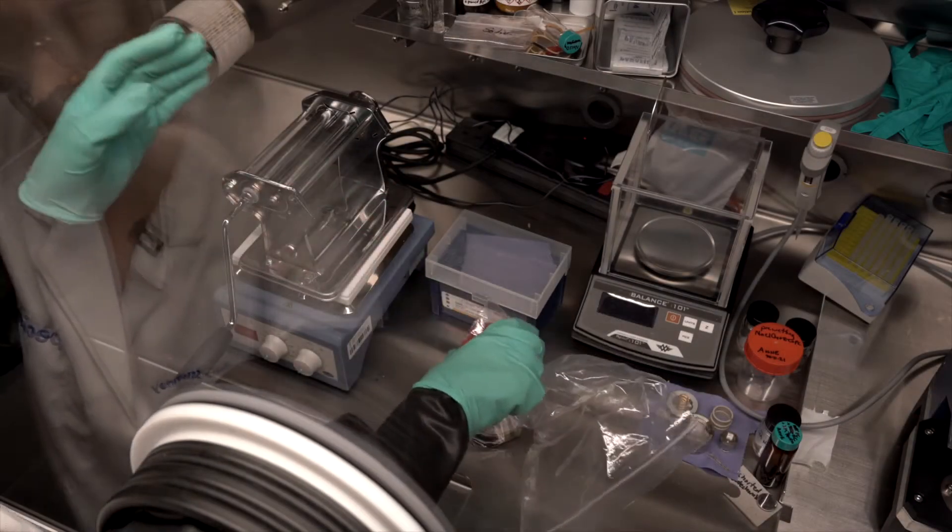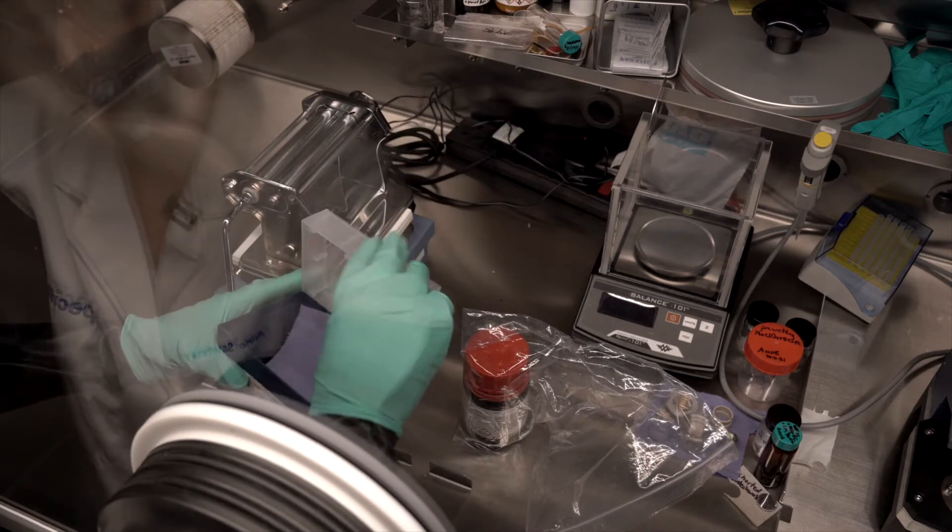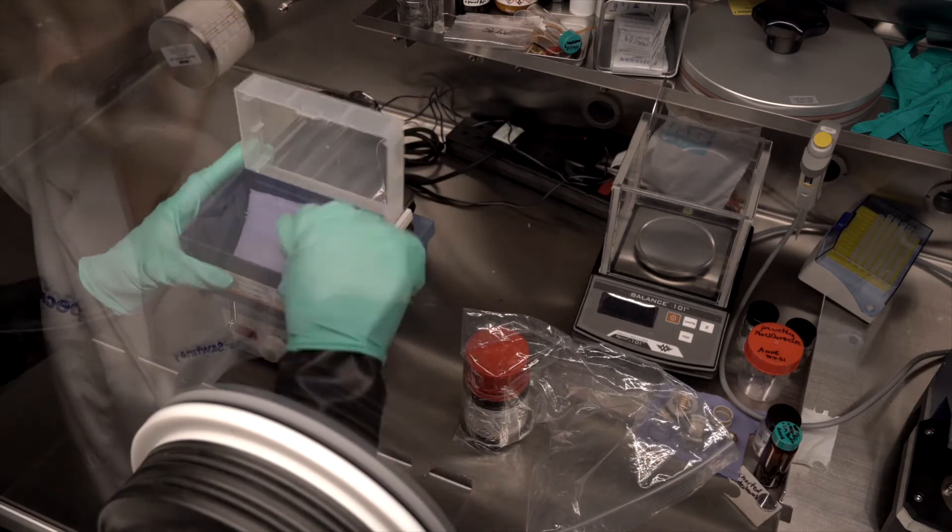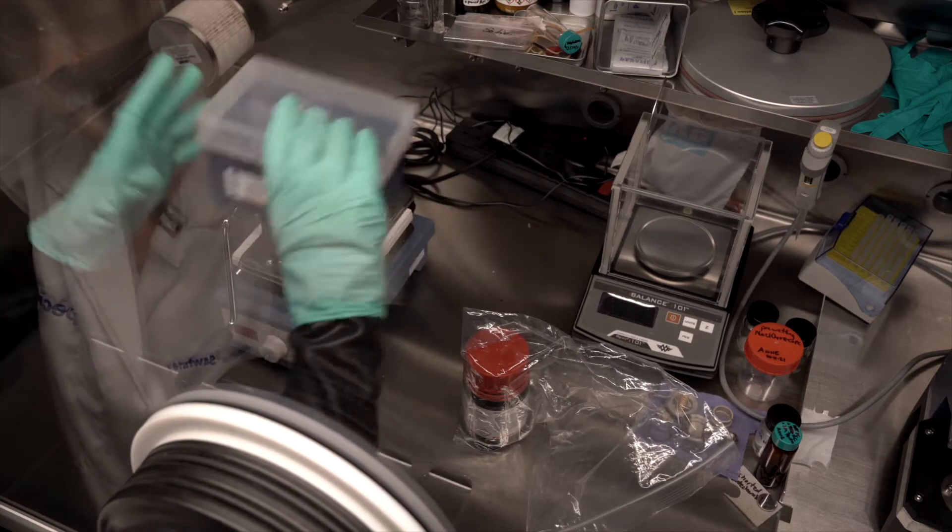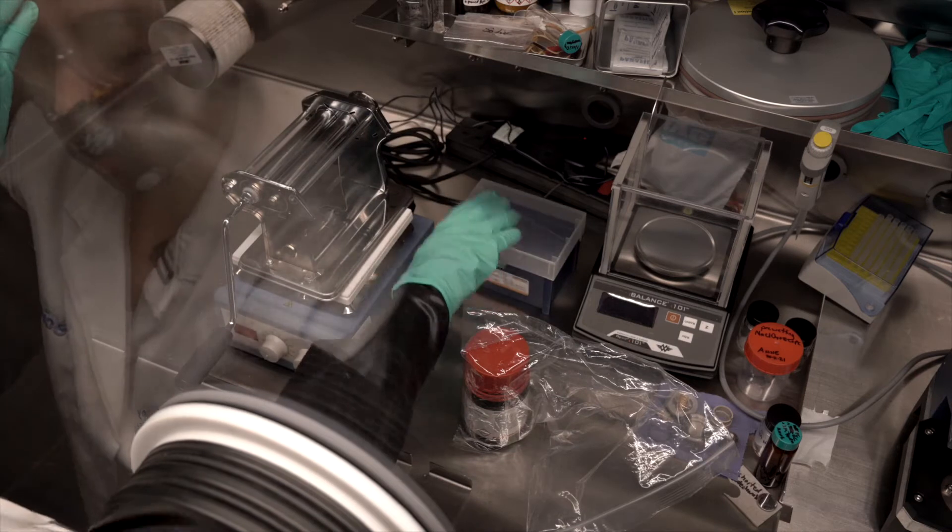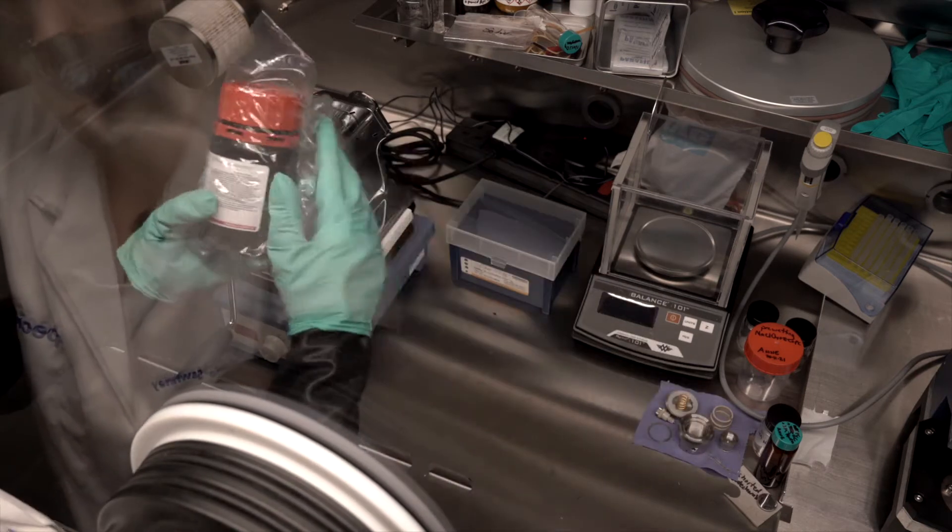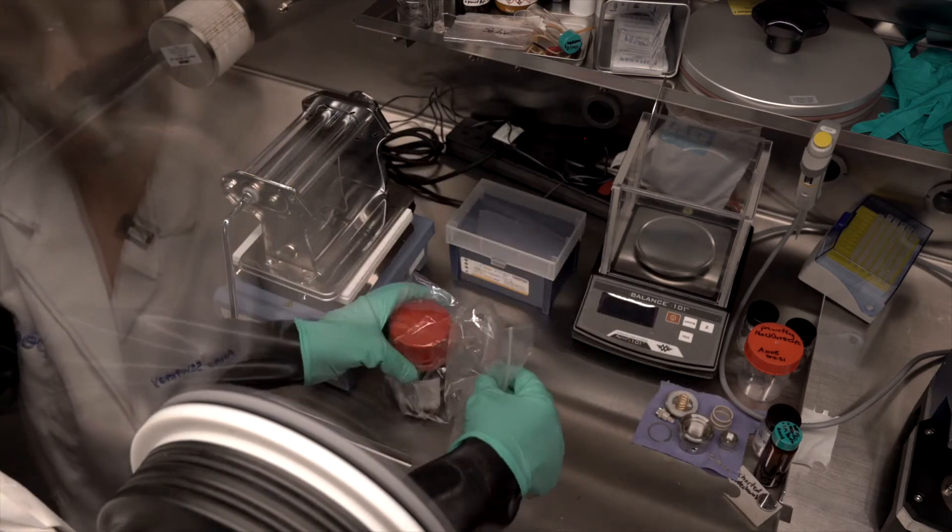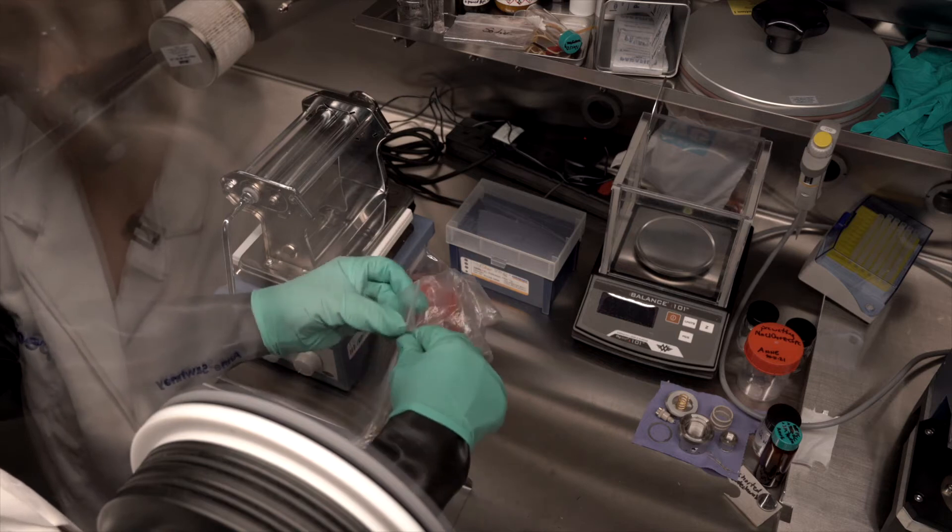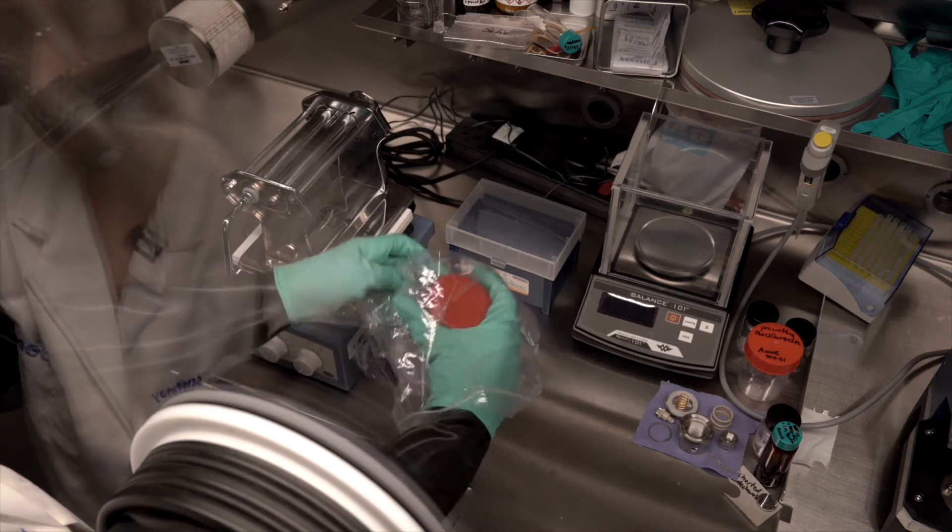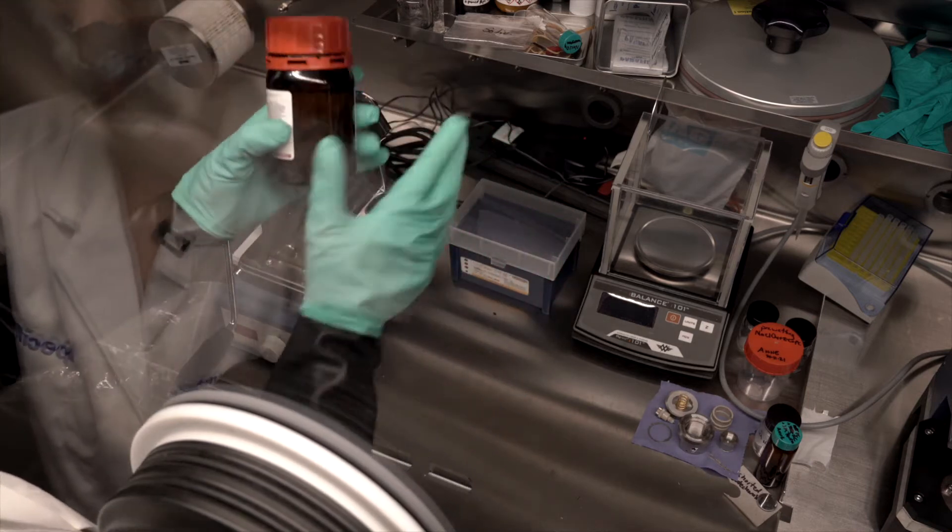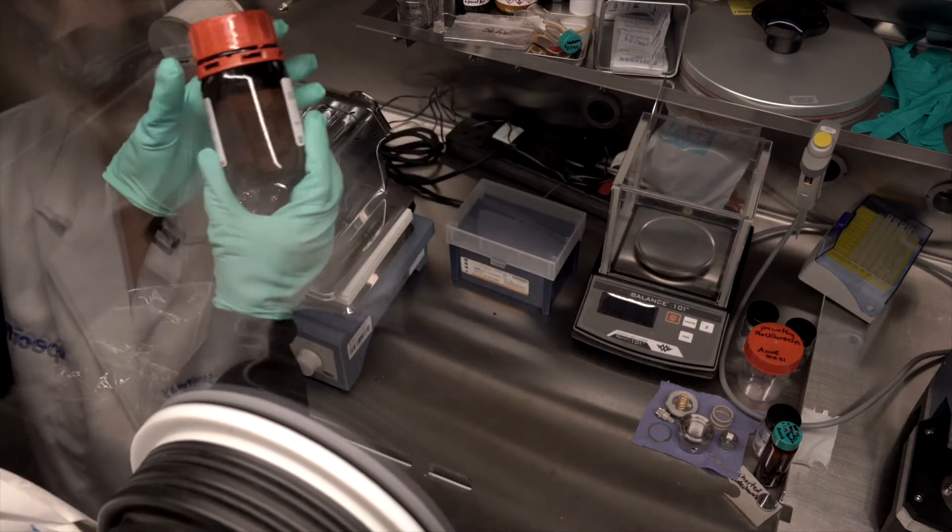So, to start, I'm going to get some wipes out because this sodium comes packaged as cubes and they're swimming in mineral oil, as you can probably see right there.